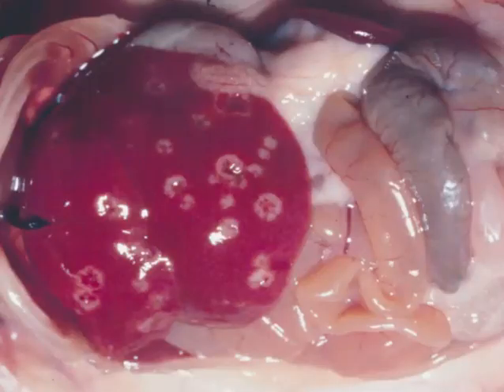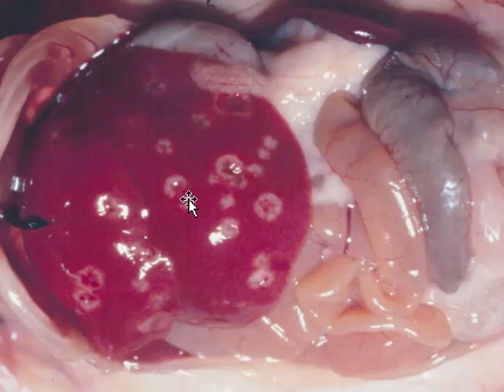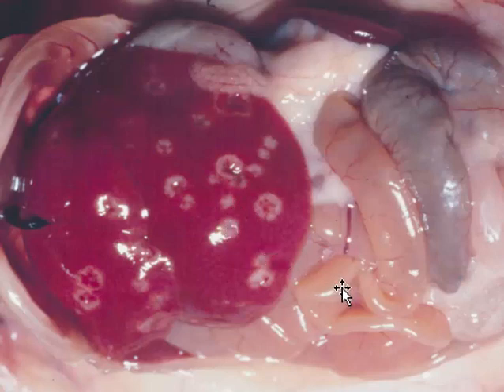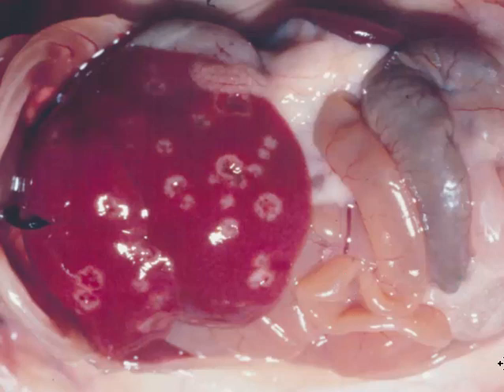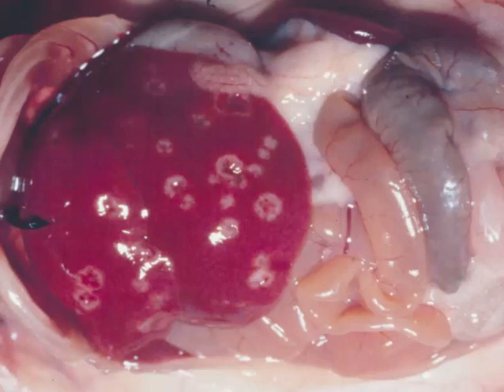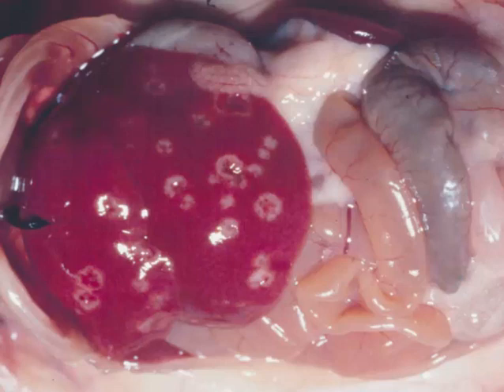Here is a liver, slightly enlarged with multifocal coalescing areas of necrotizing hepatitis. This can be a number of different agents, including Clostridium piliforme — the causative agent of Tyzzer's disease — any hot gram-negative causing septicemia, which in mice could be Salmonella or tularemia. It could also be listeriosis, a septicemic condition not often seen in rodents, but when it does occur it will cause large areas of necrosis containing gram-positive bacilli in large numbers. I also want to include Helicobacter as well as the virus ectromelia.